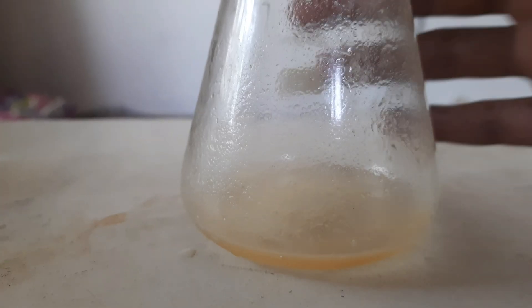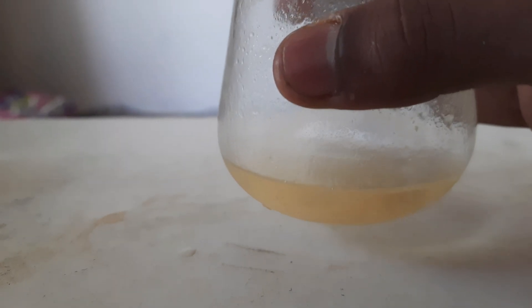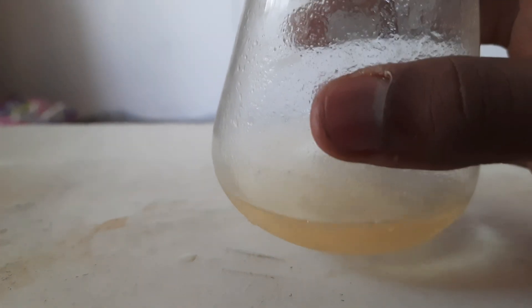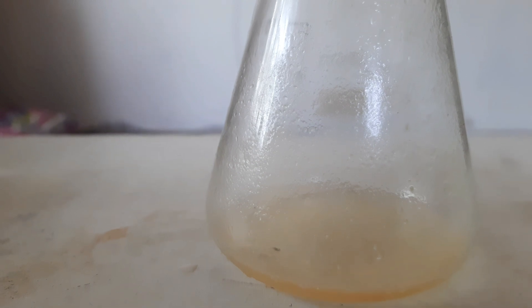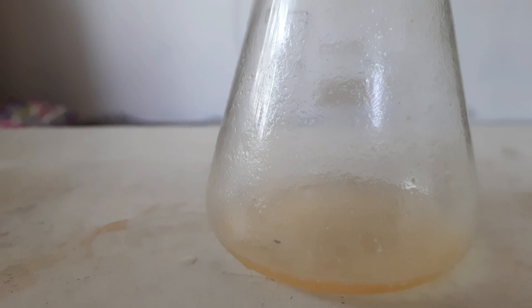Having separated the two, I got a miscible solution of glycerol mixed with water. You can also distill this to get pure glycerol, or simply evaporate it since glycerol has a higher boiling point. I've also got the precipitated soap. Since we used sunflower oil, we got a yellow sort of precipitate.